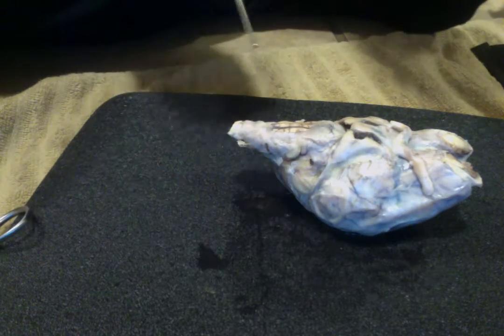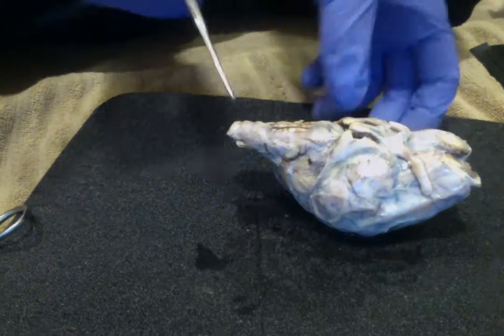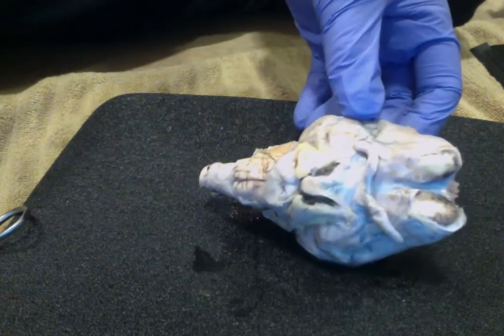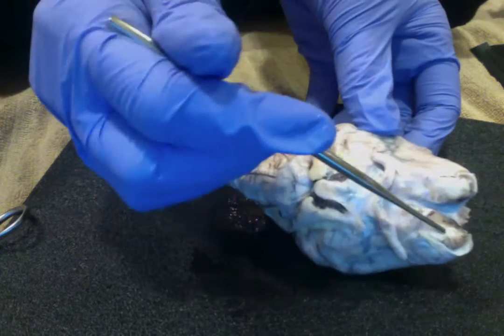My name is Ashley Porterfield and we are going to be going over areas of a sheep's brain. Right here, these are what is called the olfactory bulbs.